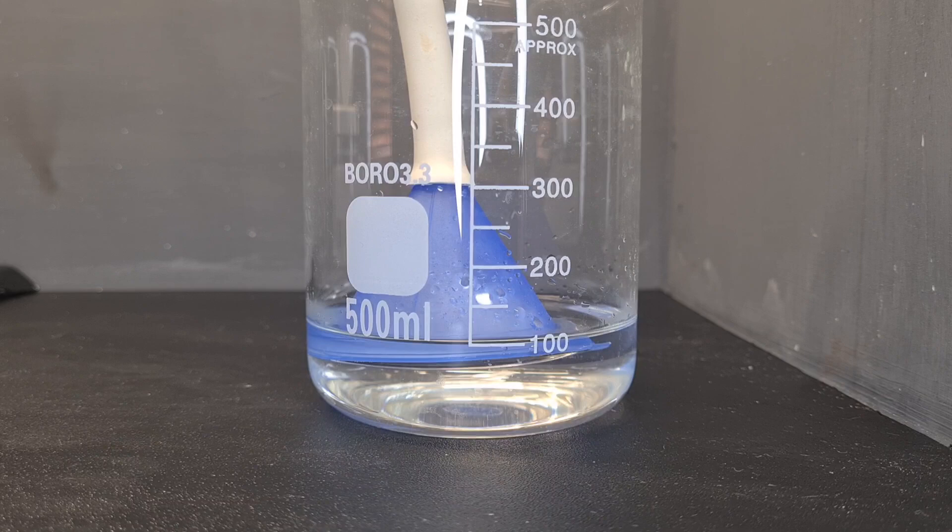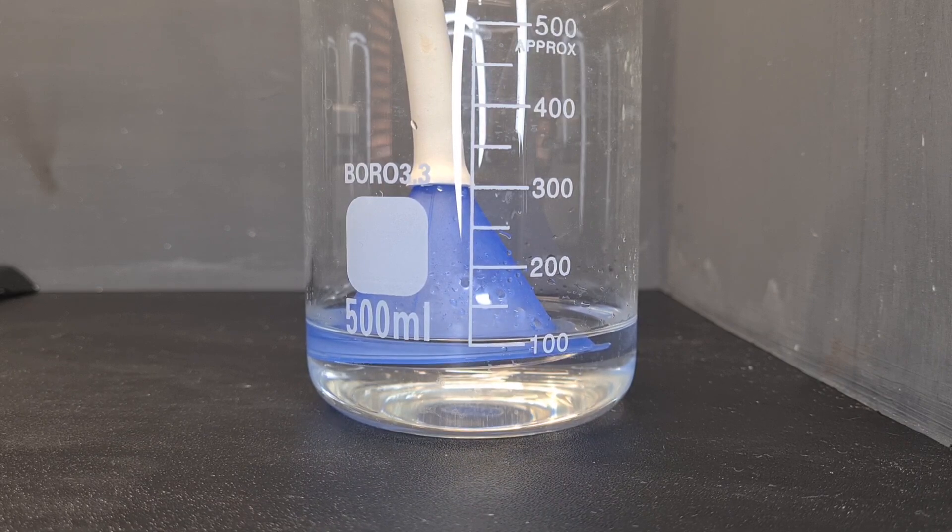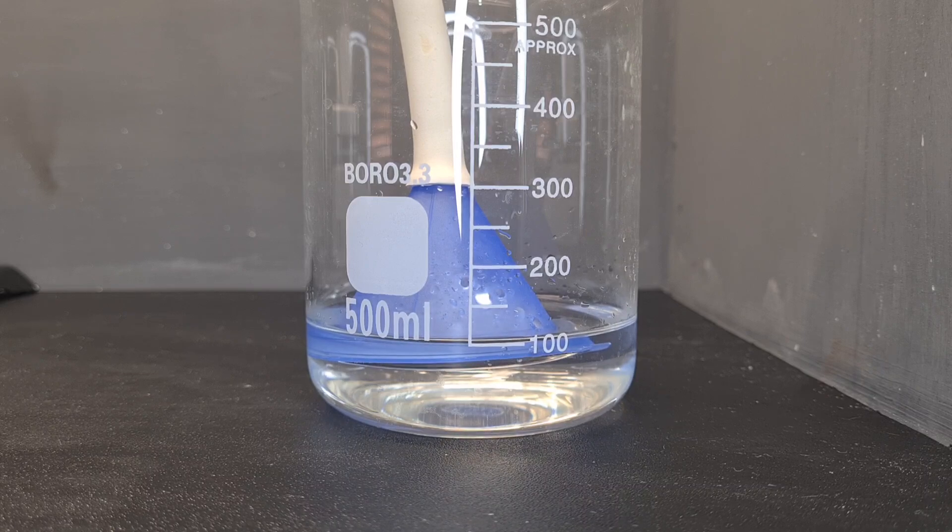And as you can see it's pulsating back and forth, which means more gas is getting there and it's just getting redissolved into solution. And this makes our ammonium hydroxide solution.